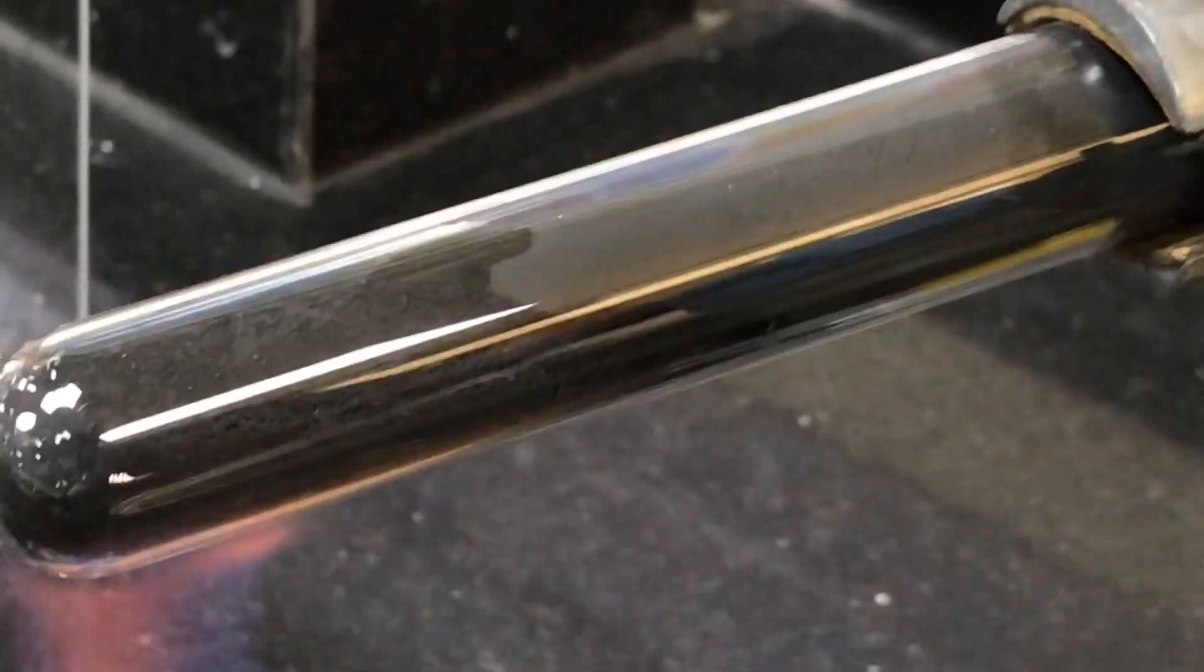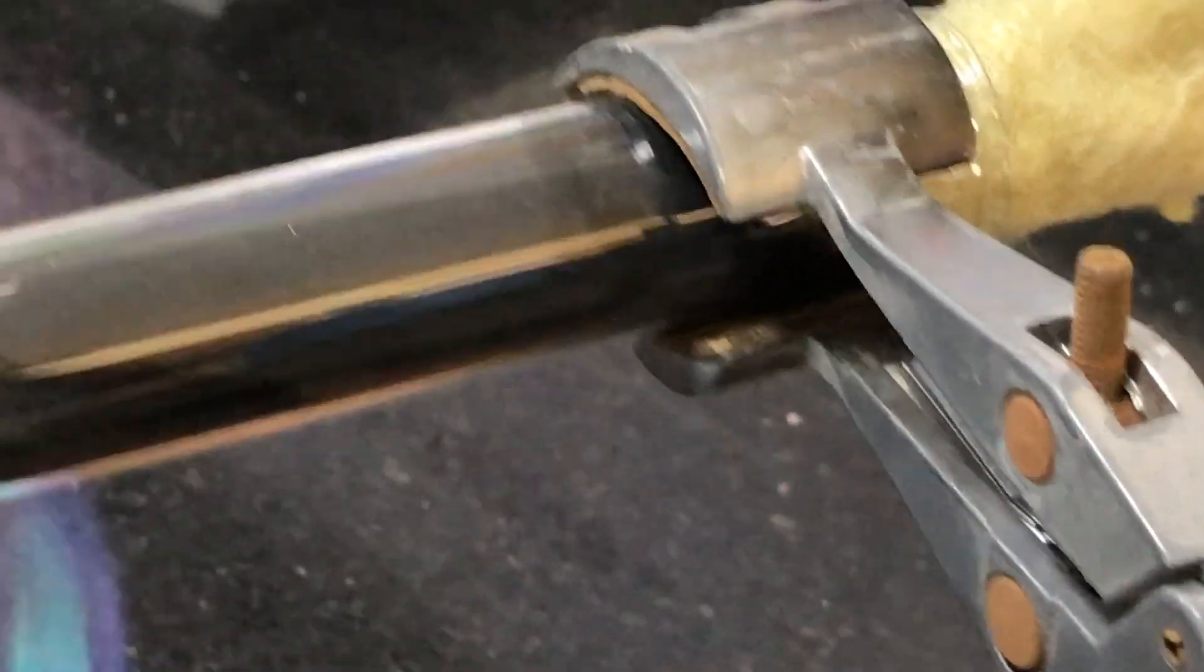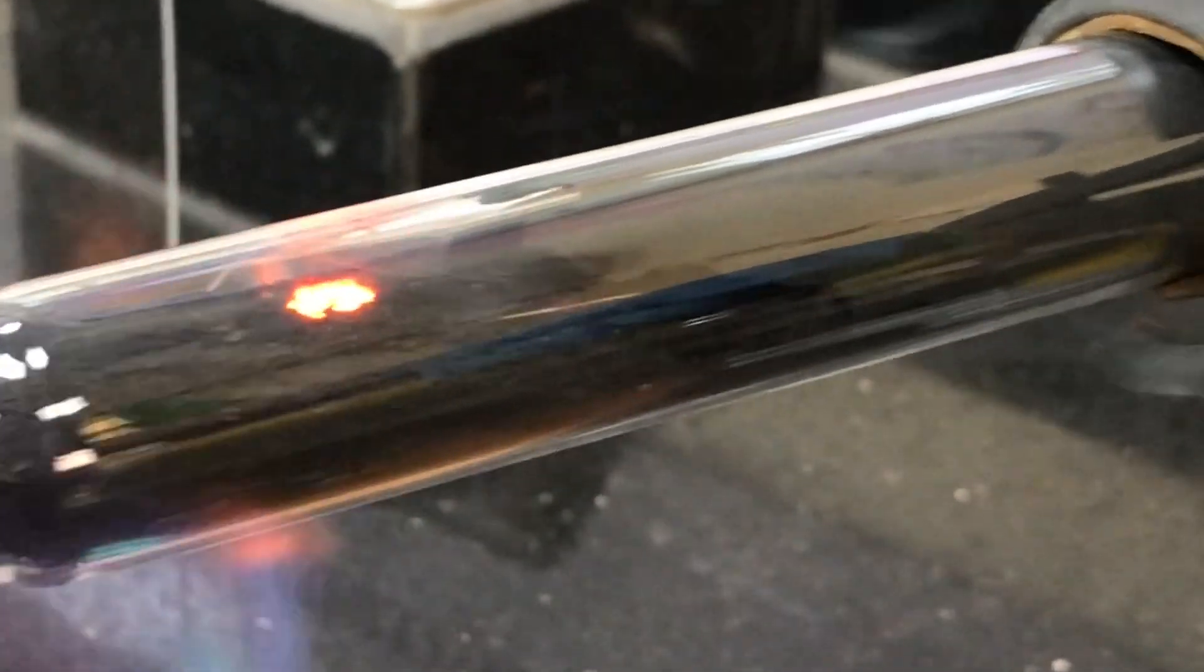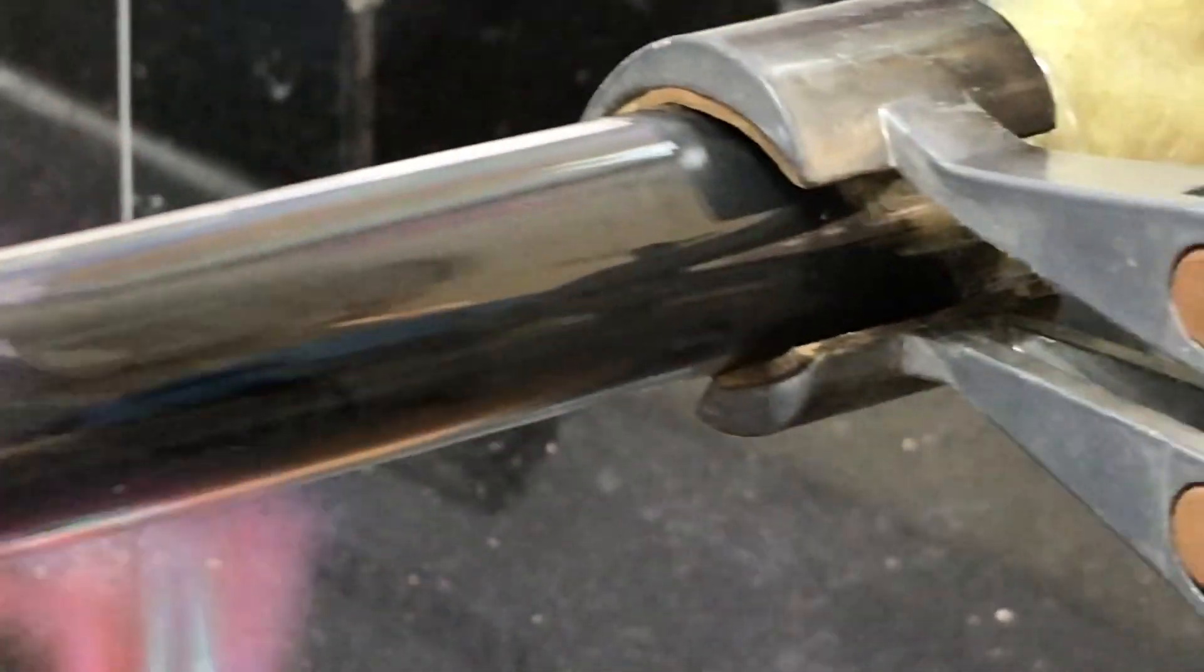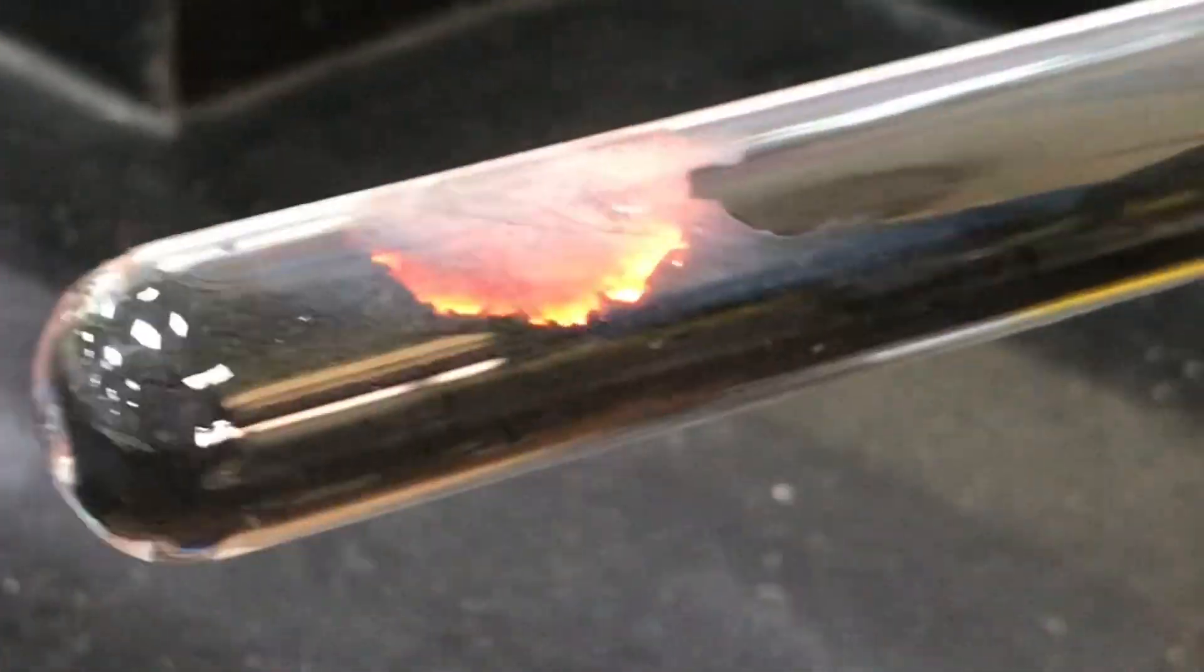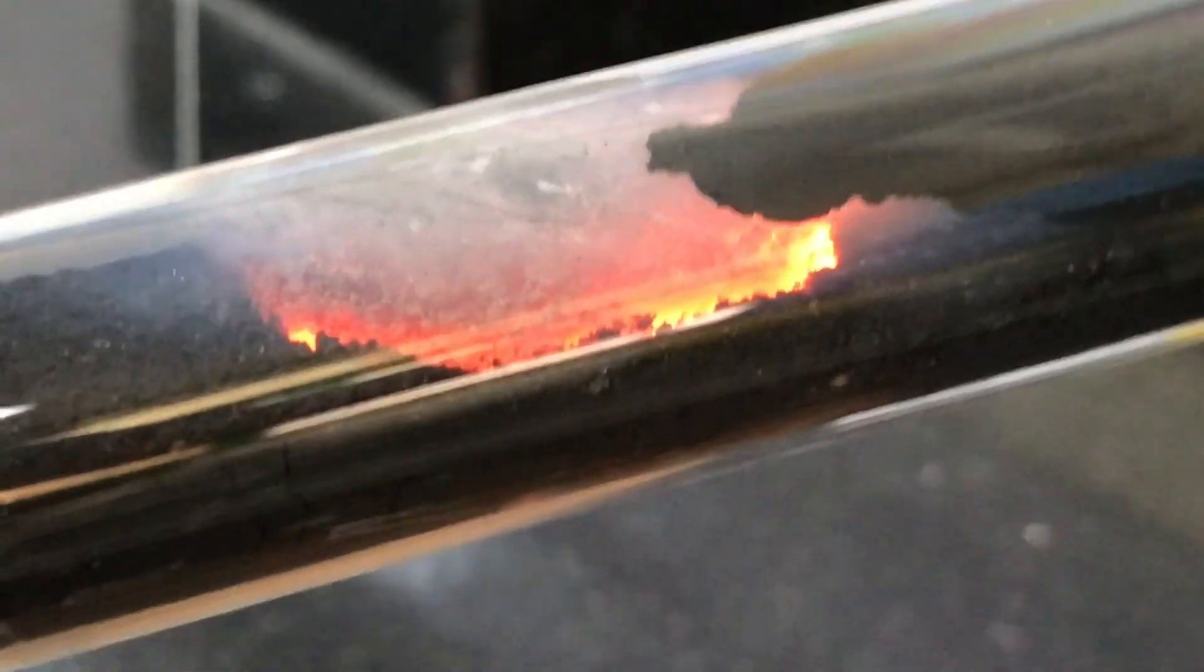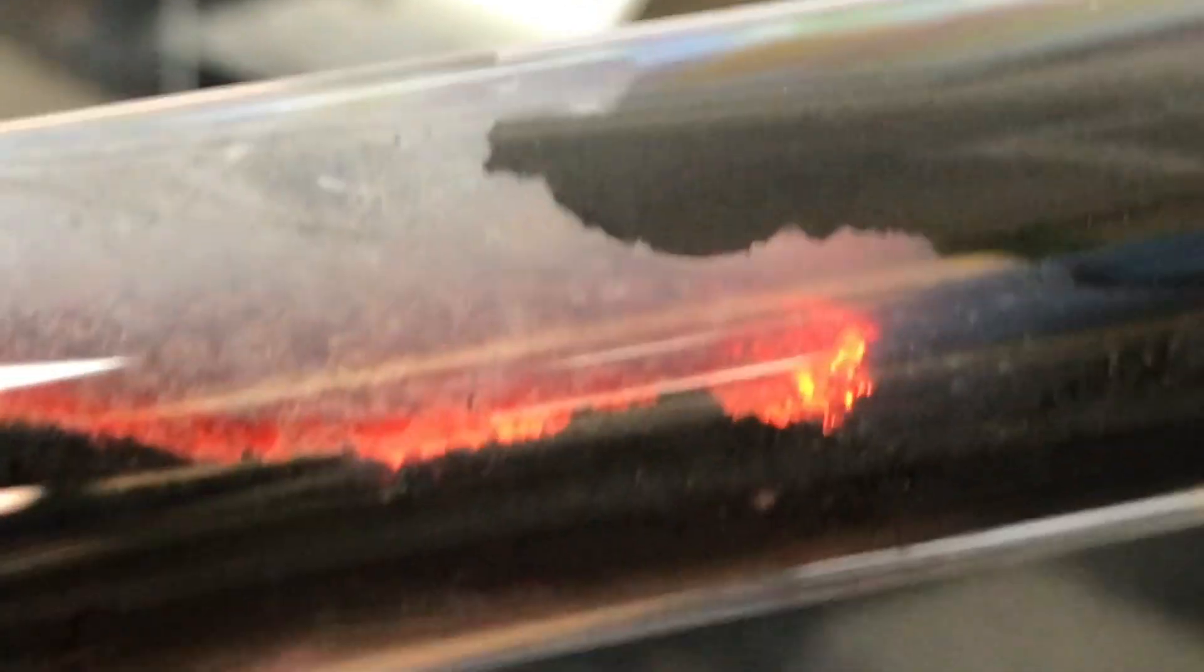So usually that gas pushing upwards on a layer that then pushes out this part of the top, so keeping it horizontal is wise. And there you go. You can take it away it will be self-sustaining. And just put it back over here.